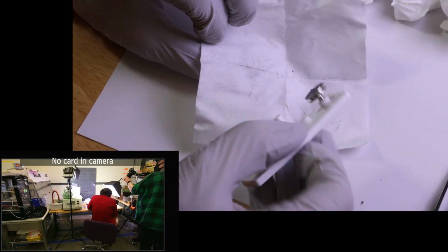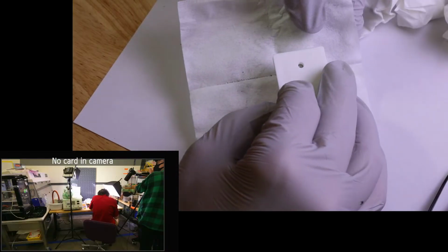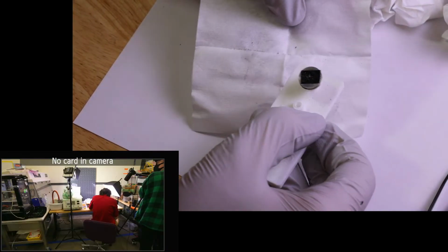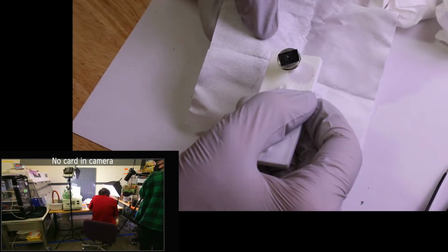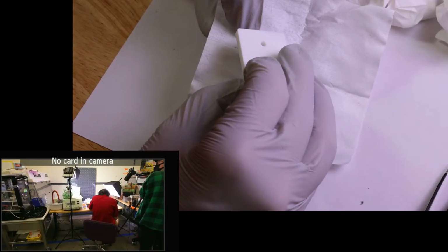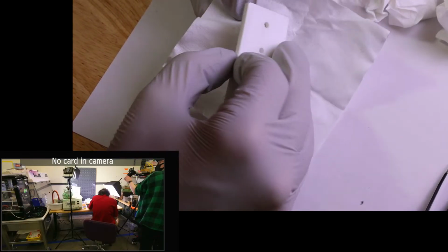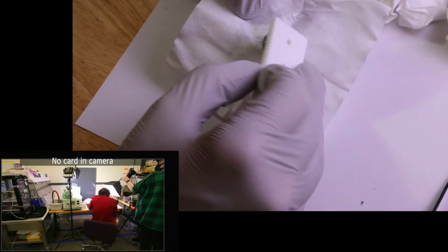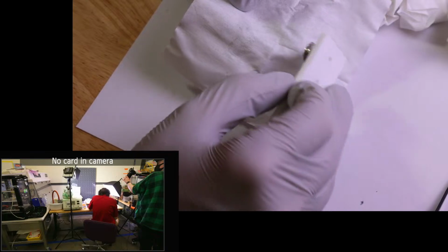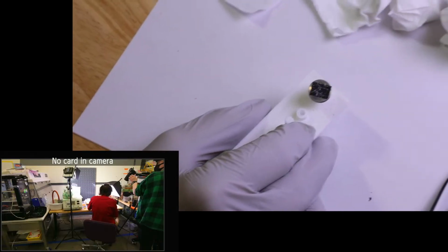Got a number of pieces of metal on there now. Let's kind of do that a few more times. We might end up with some fibers on this as well, but I think that will be just fine. Okay, so that's pretty loaded, I think.